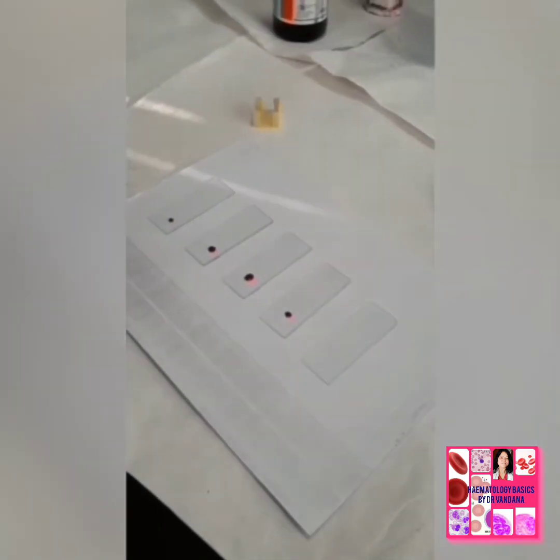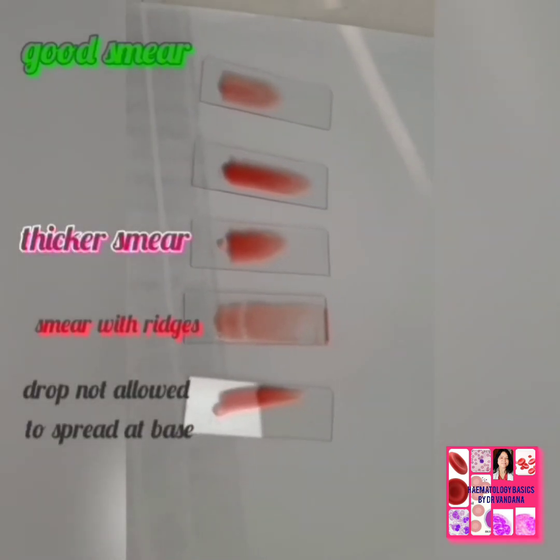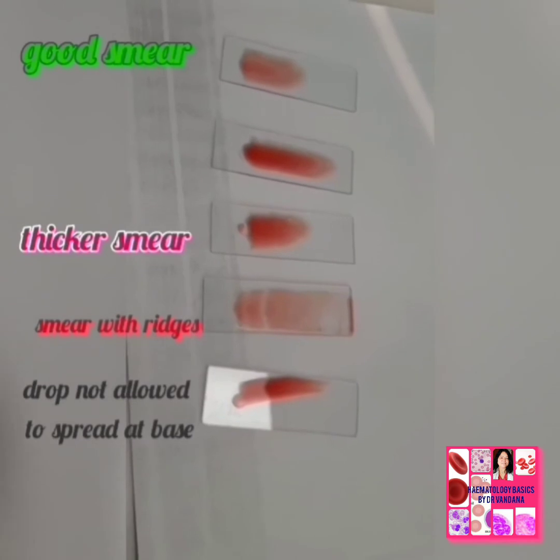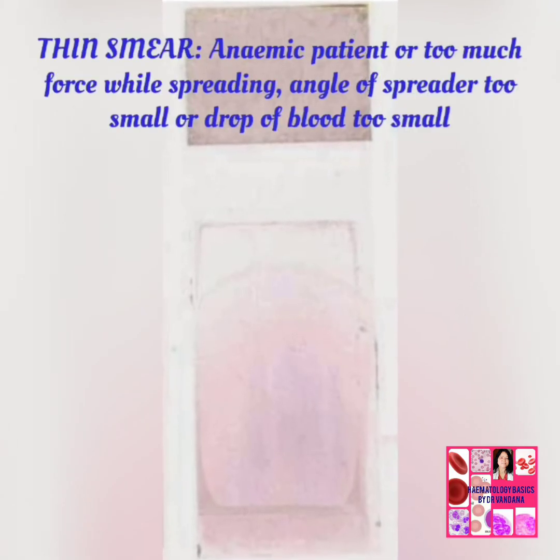So here you see some poorly made smears. You see here how my new technician is learning to make the smears. Well, he has made a good smear also, while others, I am sorry, they need to be discarded. It is better to discard the smear rather than try to improve it further. So here is the example of a thin smear.